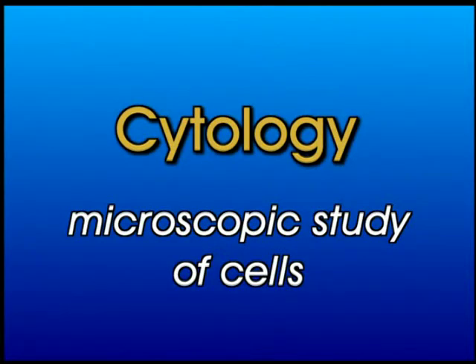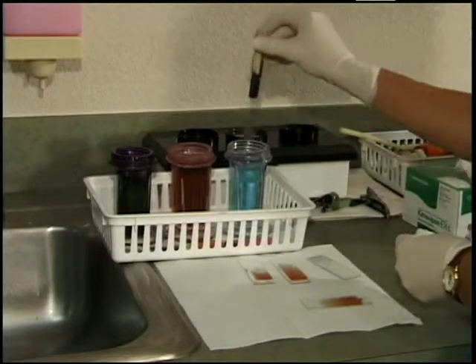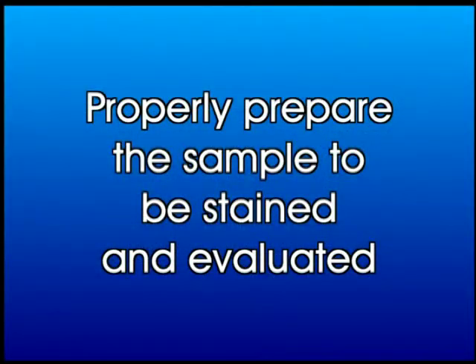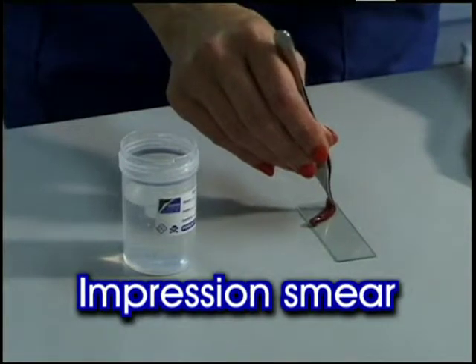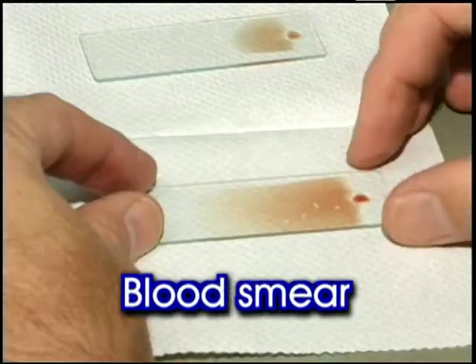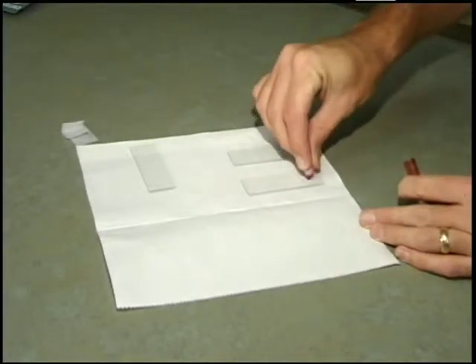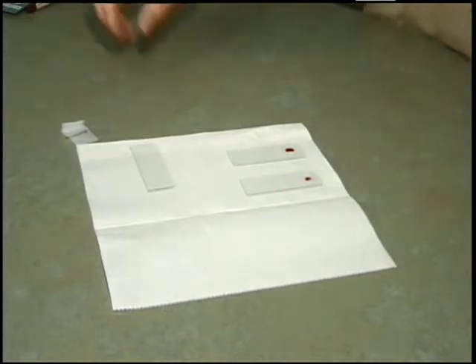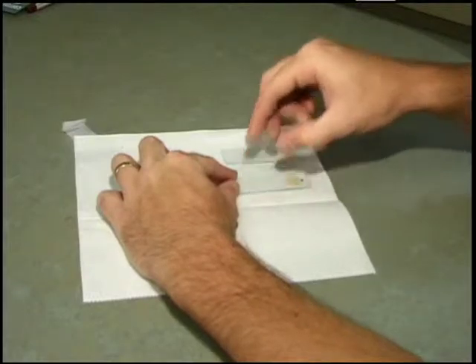Cytology is the microscopic study of cells. To enhance their visibility under the microscope, a specimen is often stained. Before staining can be addressed, we must properly prepare the sample to be stained and evaluated. We will discuss the preparation of three types of specimens: a fluid aspirated from a mass or body tissue, an impression smear made from a biopsied piece of tissue, and a blood smear. Preparing these specimens properly is absolutely essential in order for accurate results to be obtained. It is therefore very important that you handle the sample with great care and follow closely the instructions.